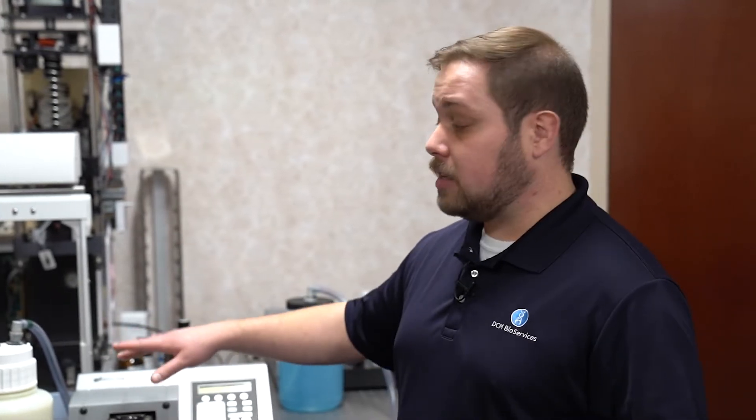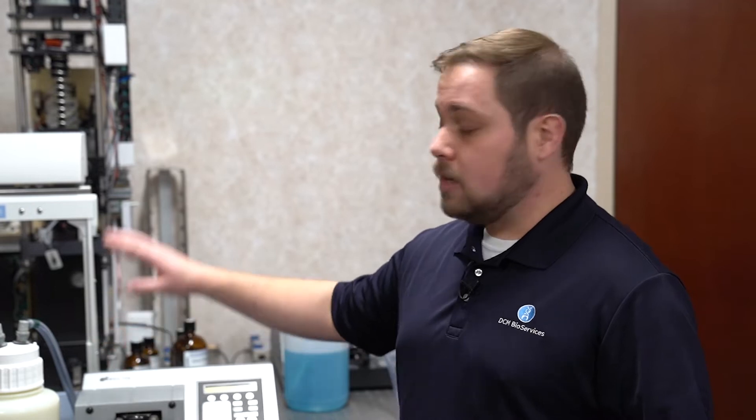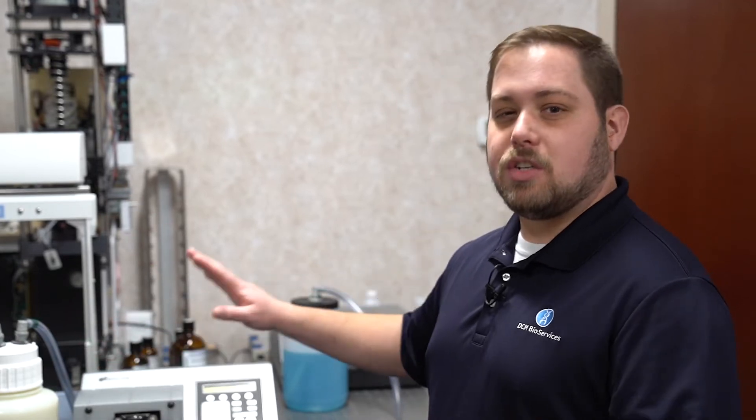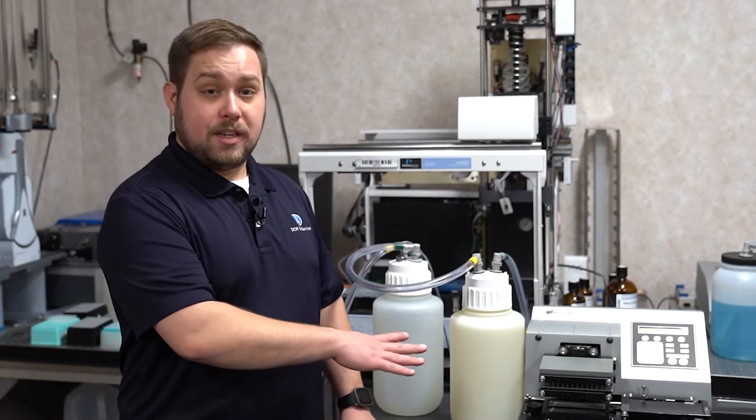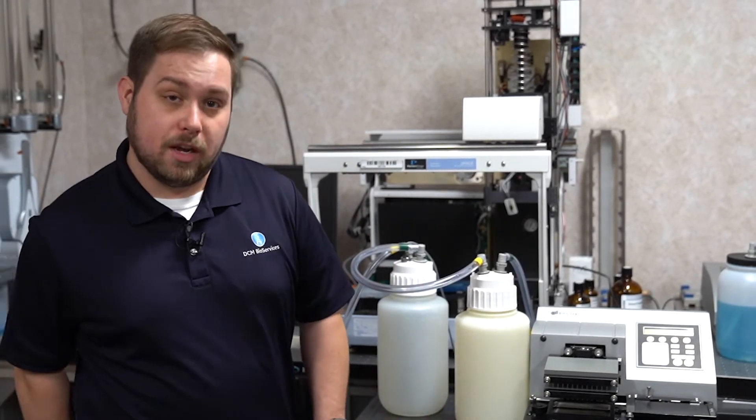Today we're going to cover specifically the waste system. In particular, we're going to go over the fittings themselves, bottle caps, and basic troubleshooting methods. When inspecting the waste system, it's best to decontaminate your instrument first, but I always recommend wearing gloves.